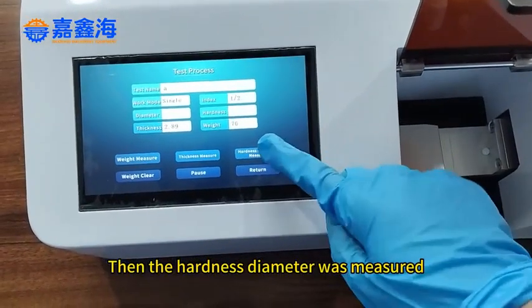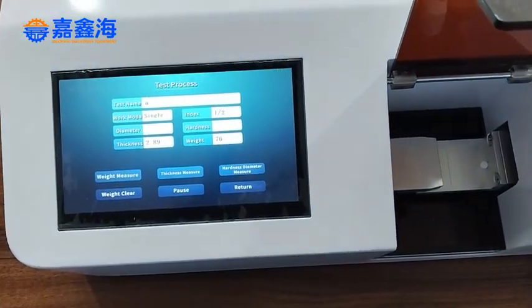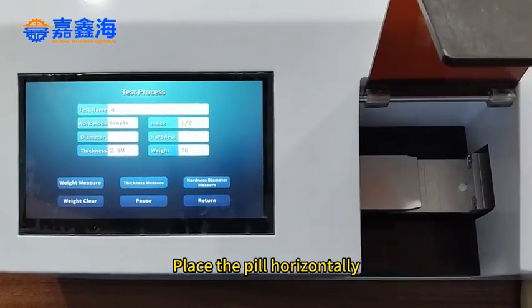Then the hardness diameter is measured. Place the pill horizontally.